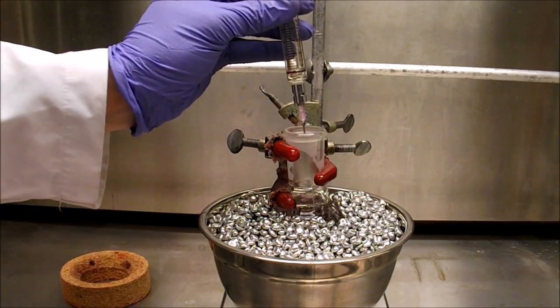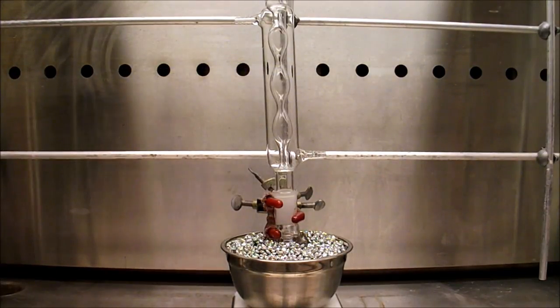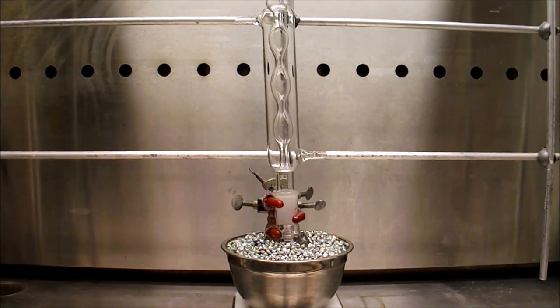Finally, ethylpropylamine is added via a syringe. After adding all the reagents, a reflux condenser is placed on the round bottom flask.